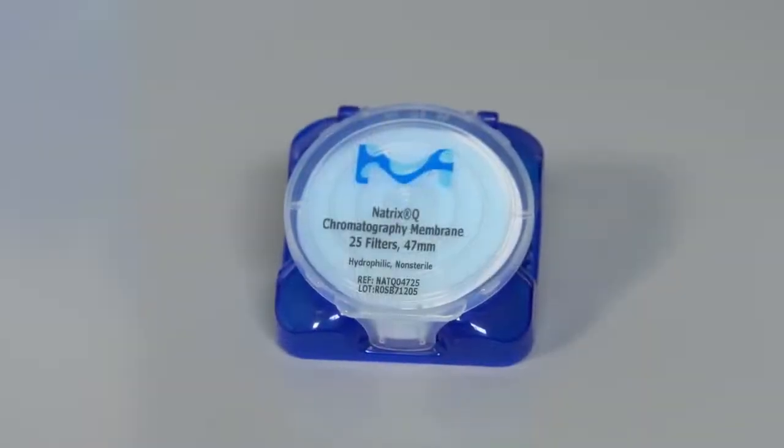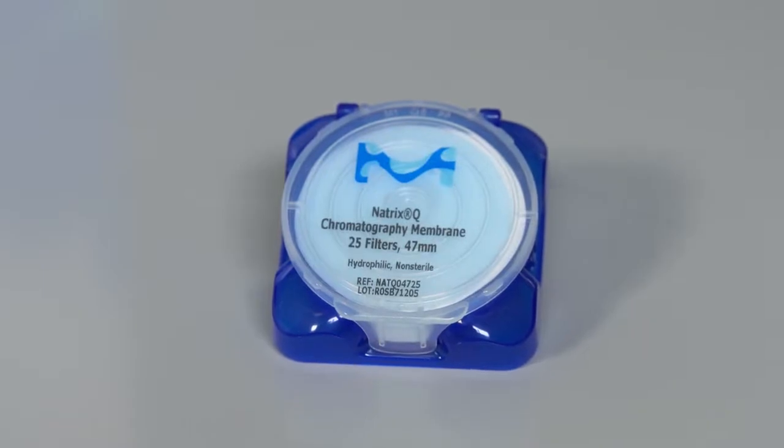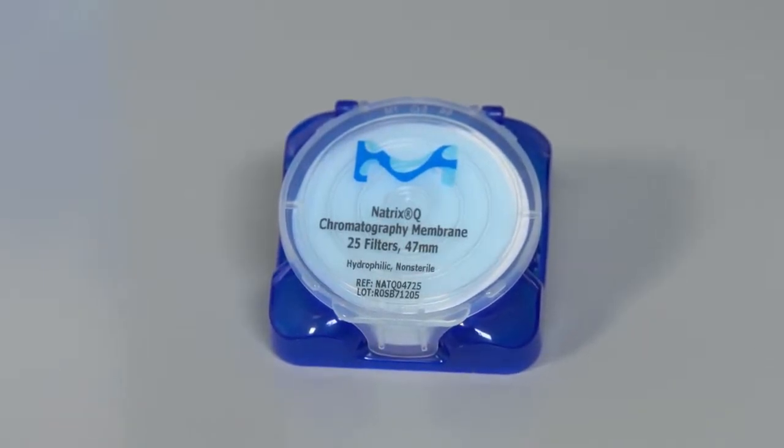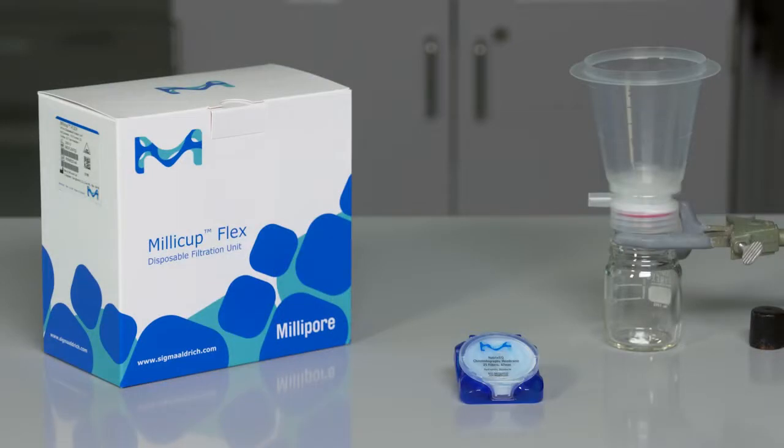Natrix Q is a polyacrylamide hydrogel membrane with a strong positive charged ionic surface. Millicupflex is a polypropylene disposable filtration setup.